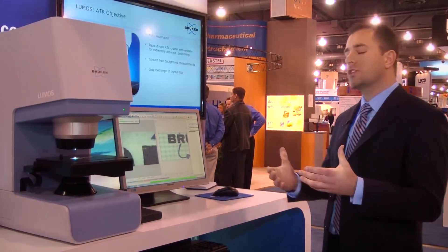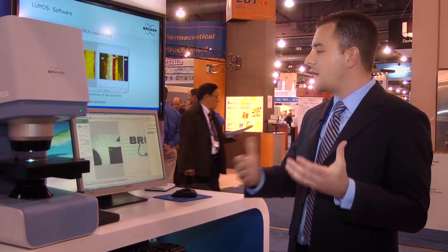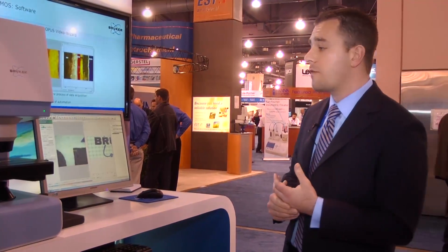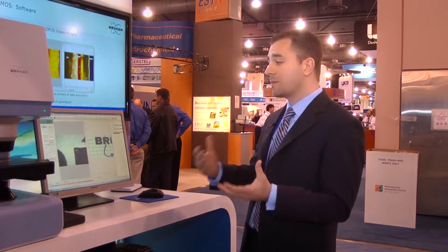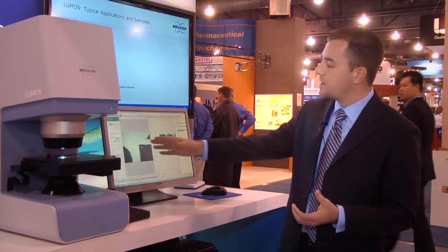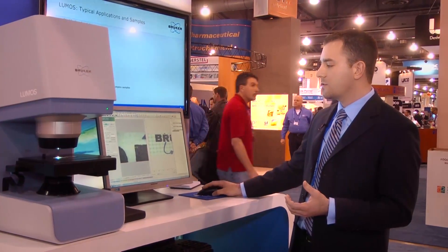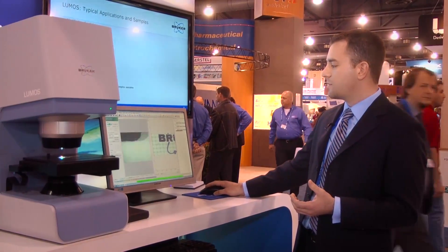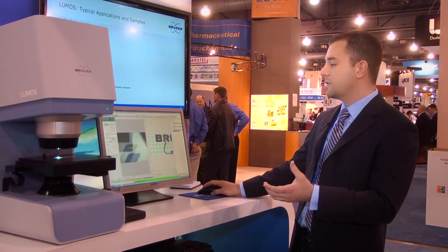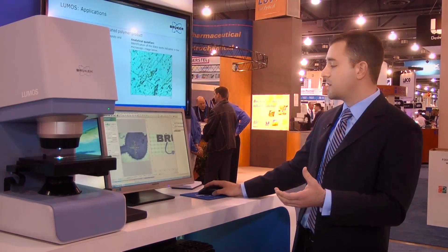The level of automation on the Lumos is really like nothing else on the market — it's gone beyond anything commercially offered, and it's something Bruker is really excited about. Within our software package, we have our live image and our static image. By clicking to move to different positions, I can click on my static image and go anywhere, ready to start my sample analysis.